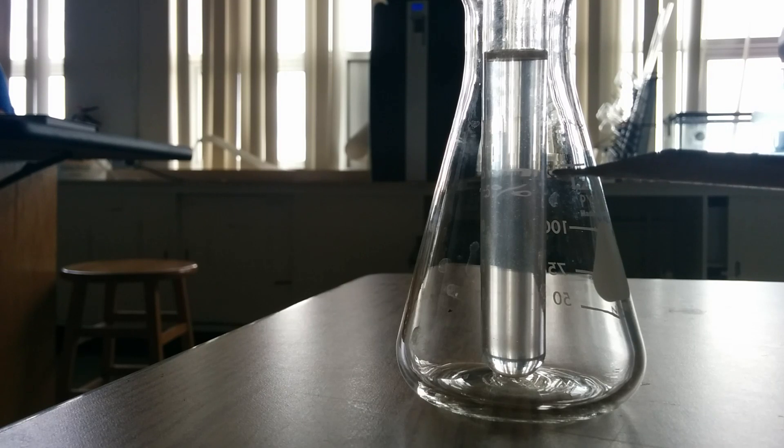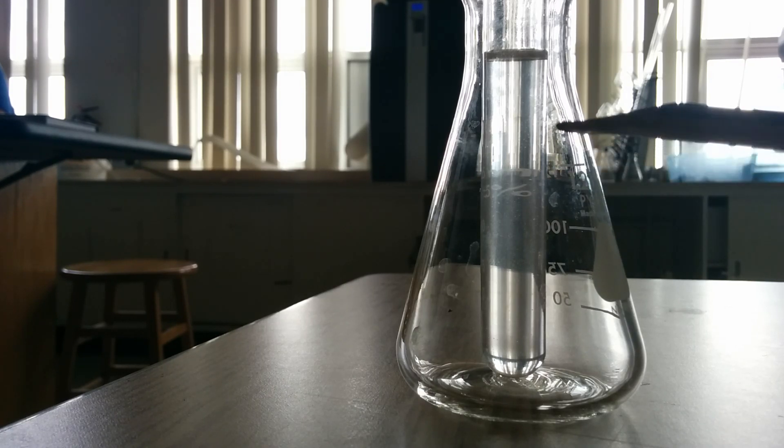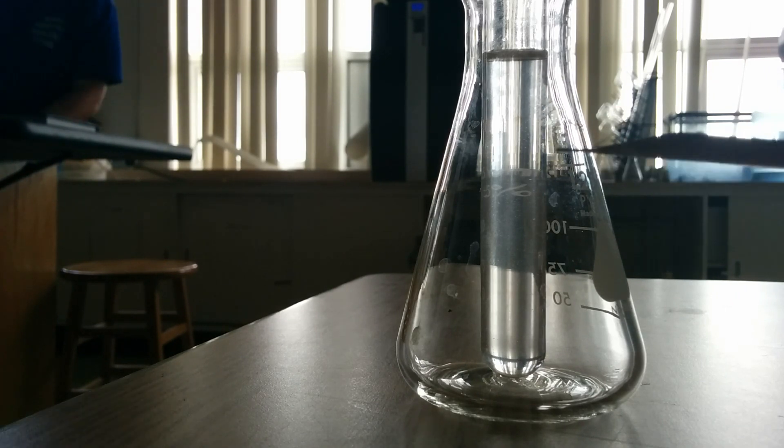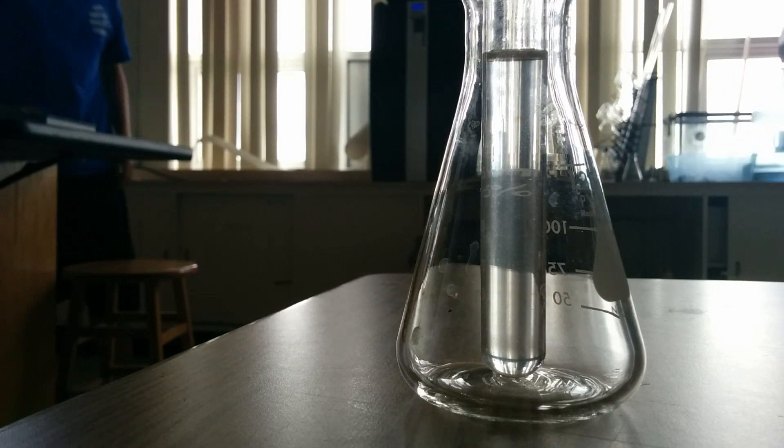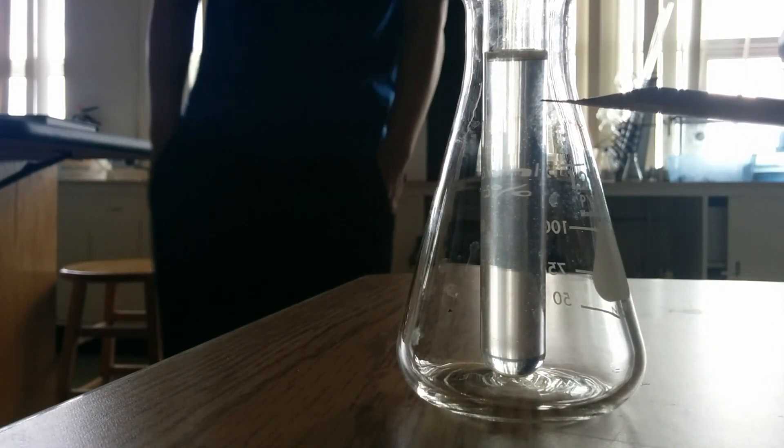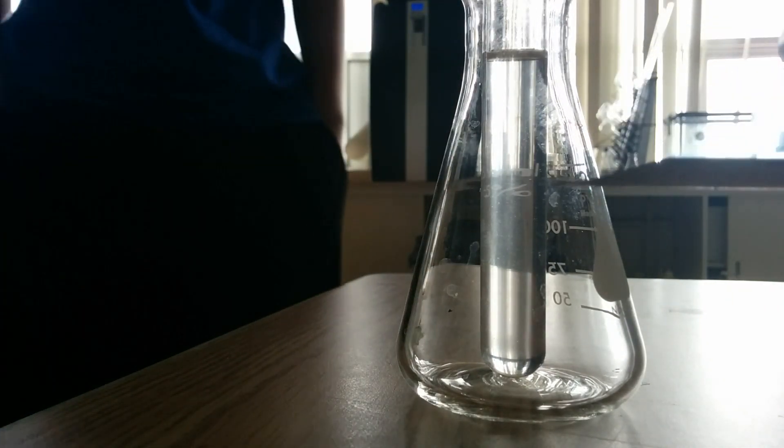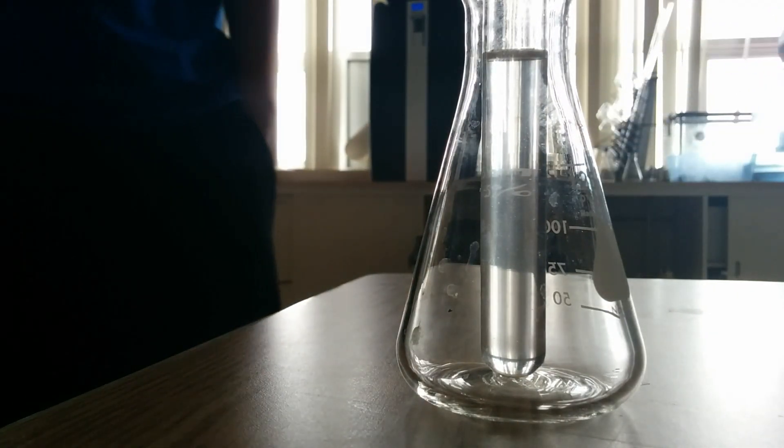This solution is supersaturated because it's holding more than it should be able to at 25 degrees Celsius. All it's going to take is for me to put a tiny crystal in there and the rest should crystallize out. Let's see how that works.